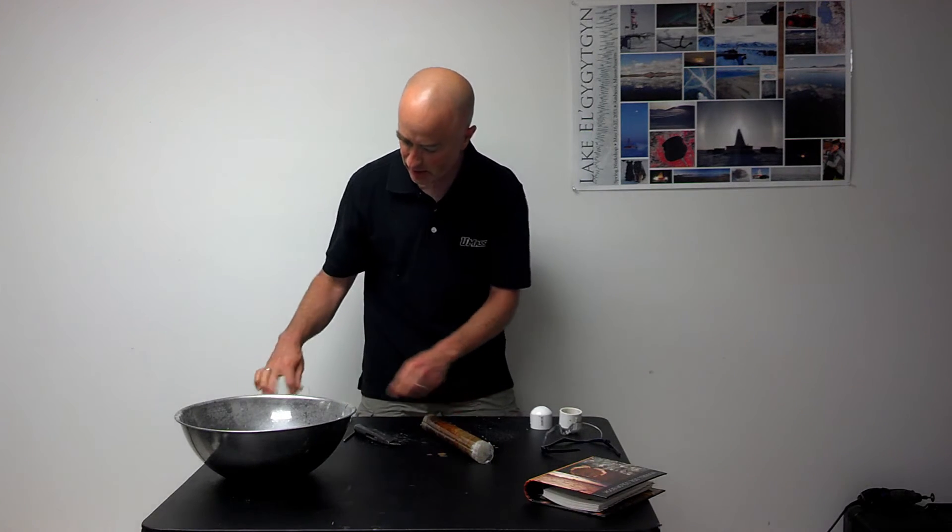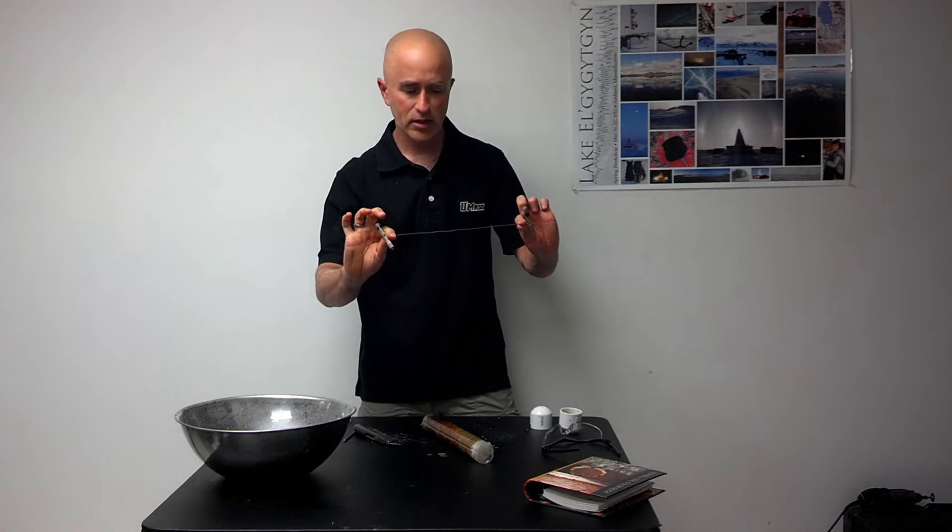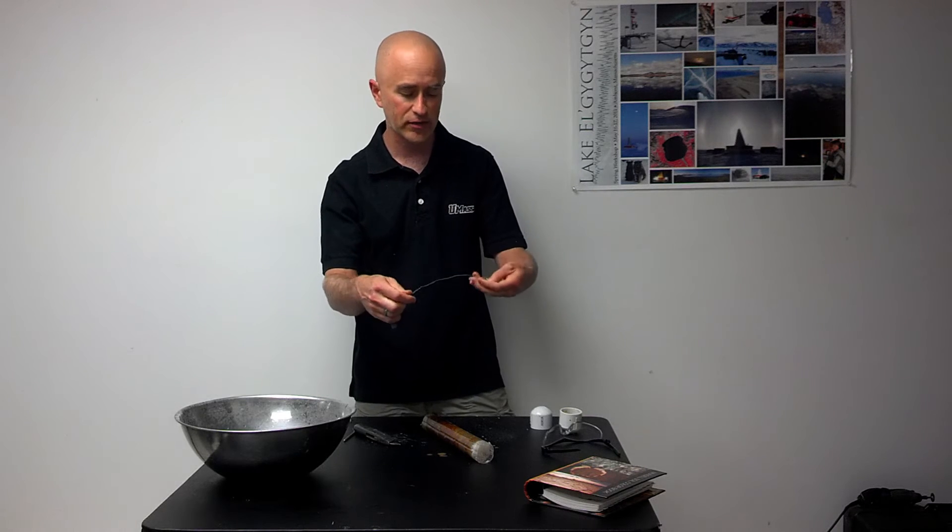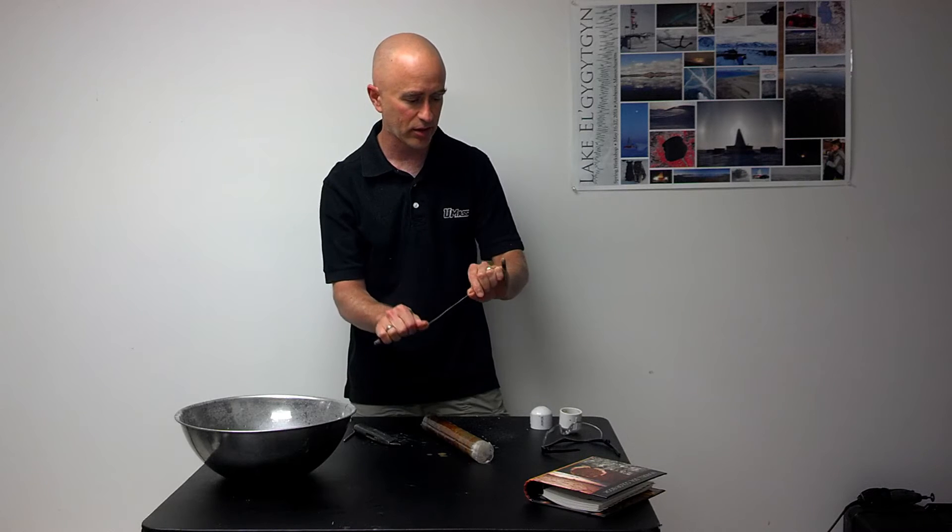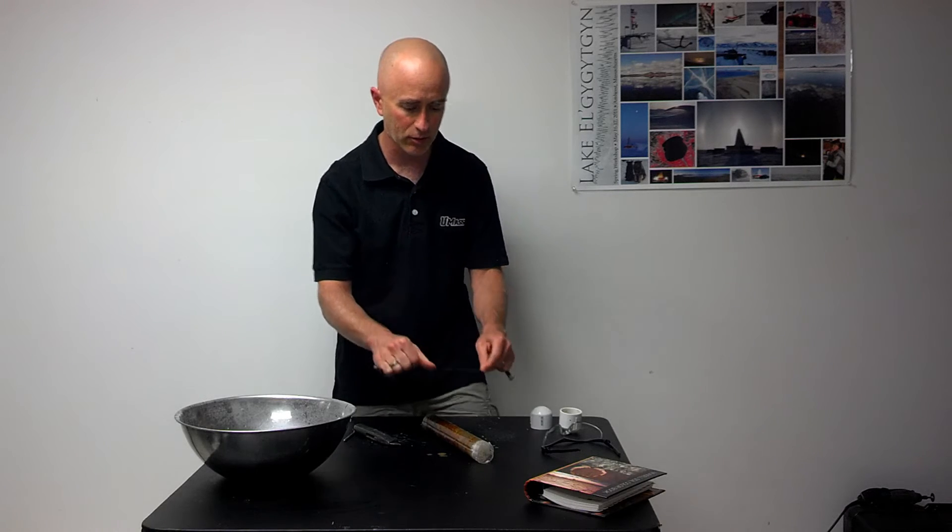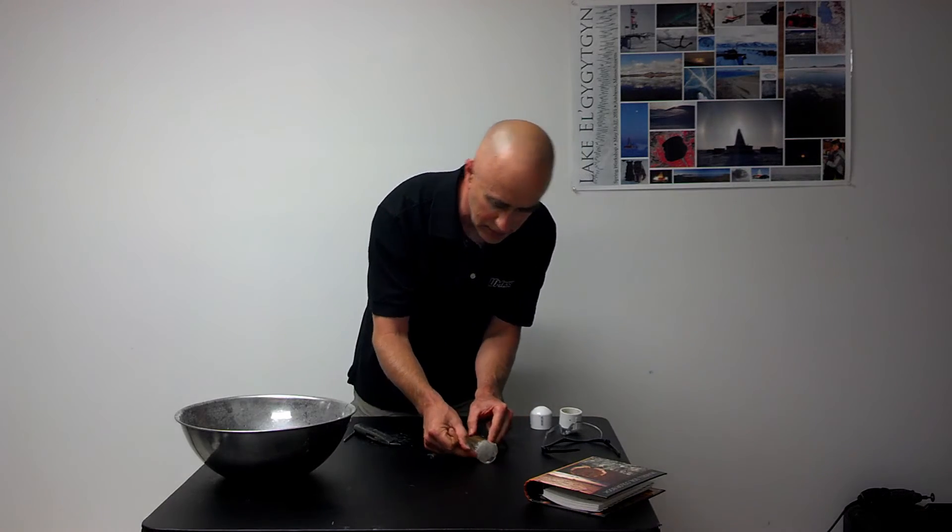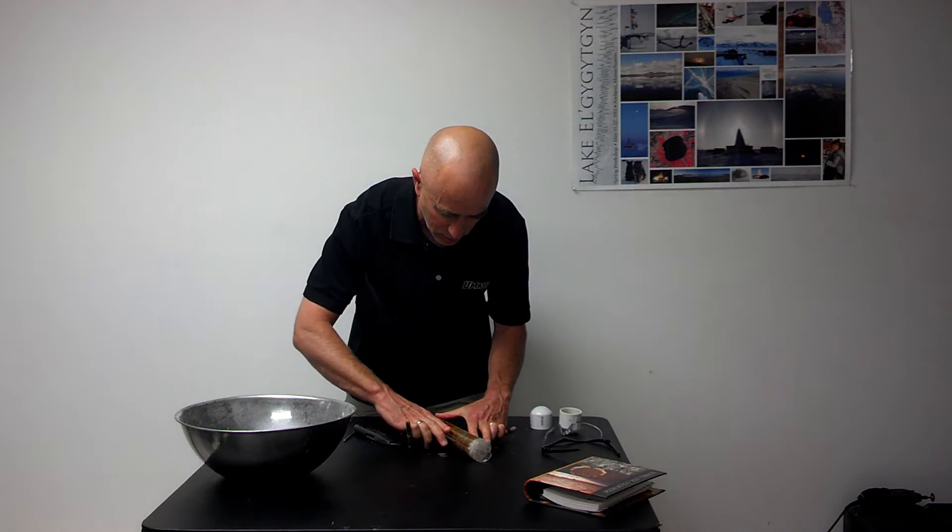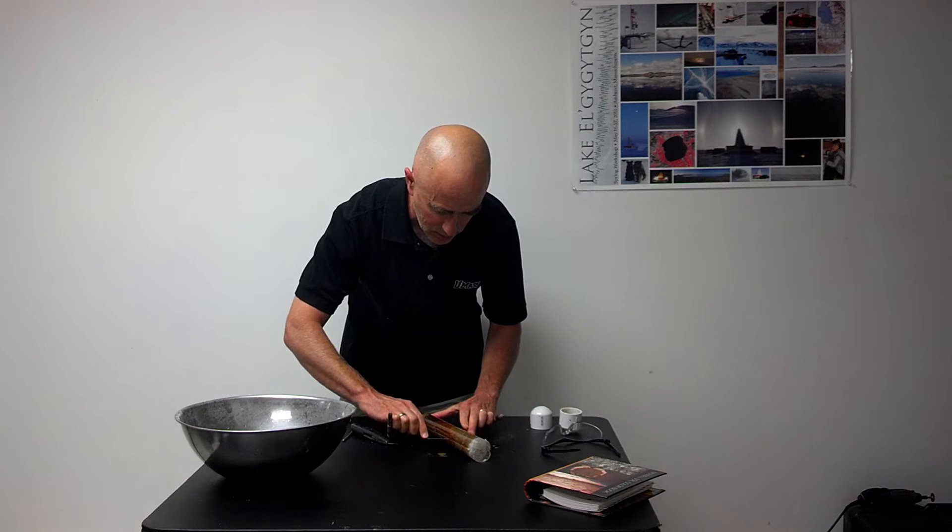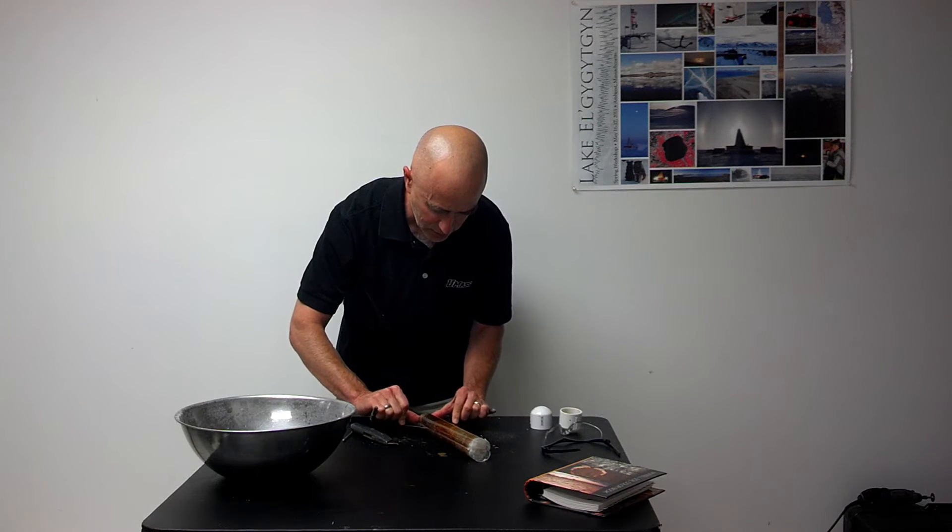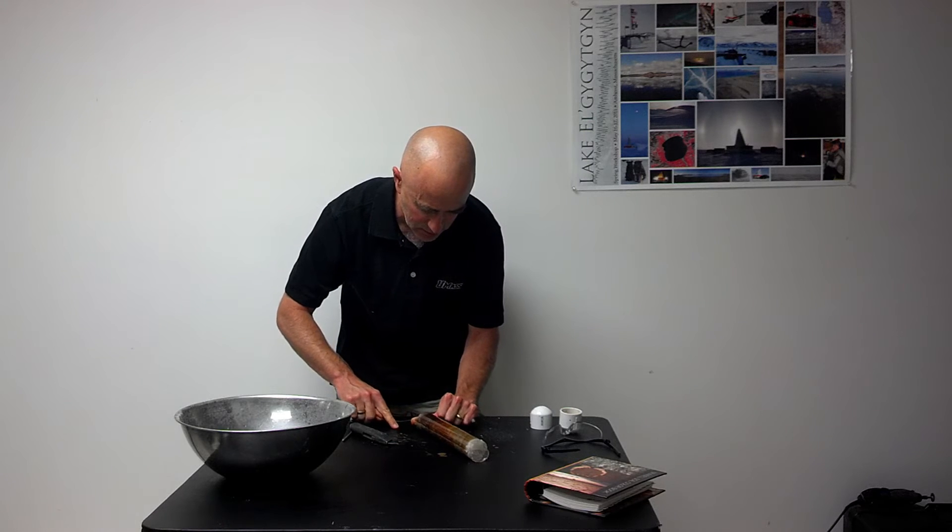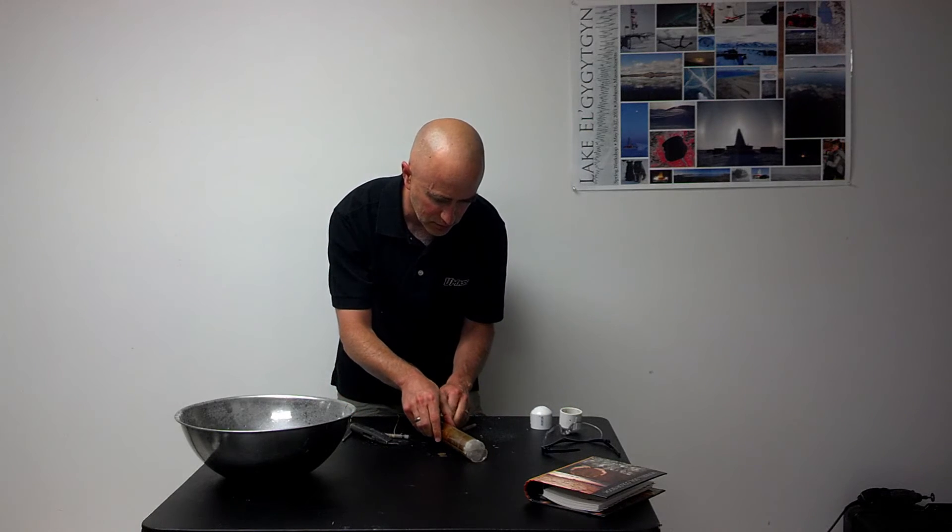Now I'll take a wire tool. This is just a wire cutting tool that can be purchased from any craft supply or art supply where they sell tools for people who work in clay. I'll slide this wire right down through the slit in the core that I just made with a knife, and then hopefully the core will come cleanly into two pieces.